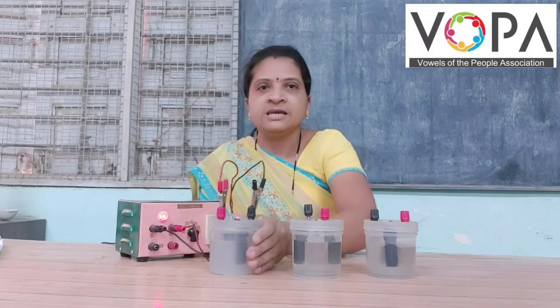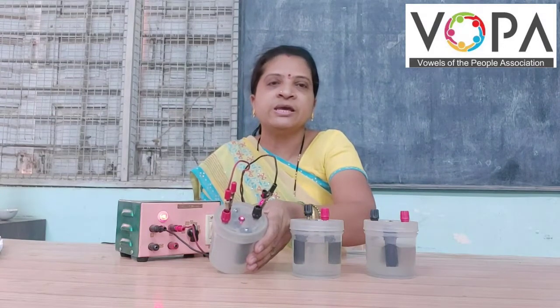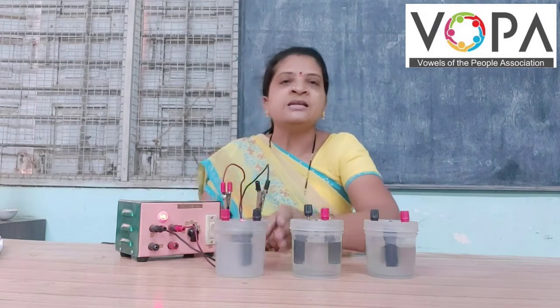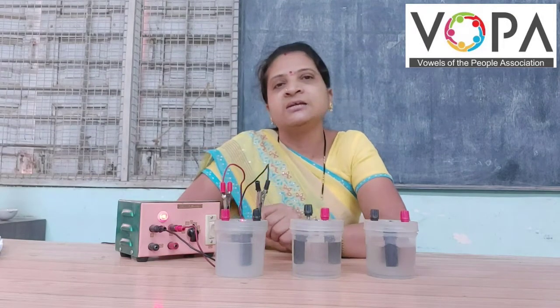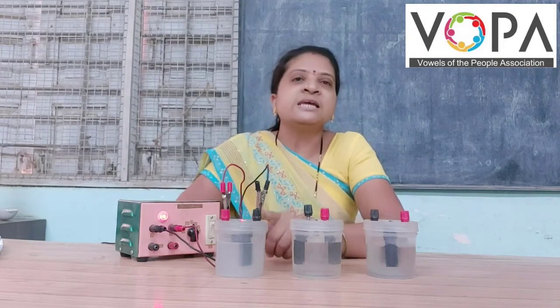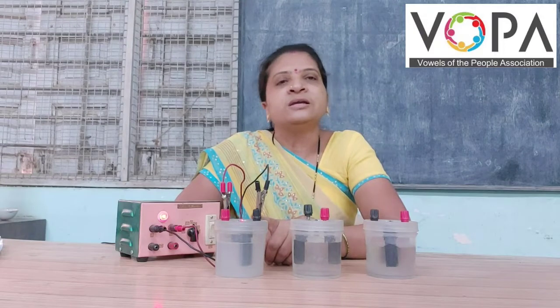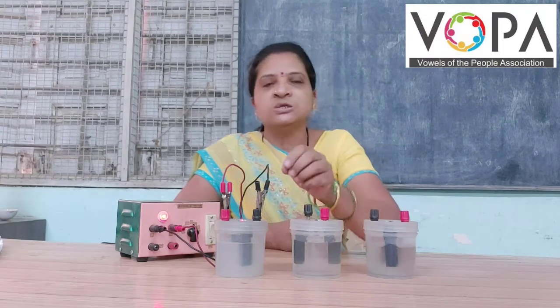Now see — the bulb is glowing. This indicates that this sodium chloride solution is an electrolyte, meaning electricity can pass through this solution.